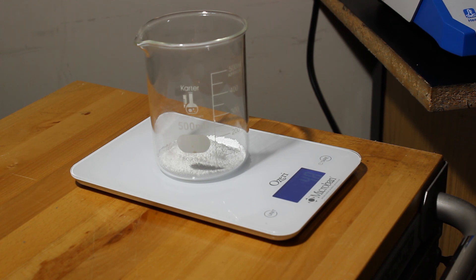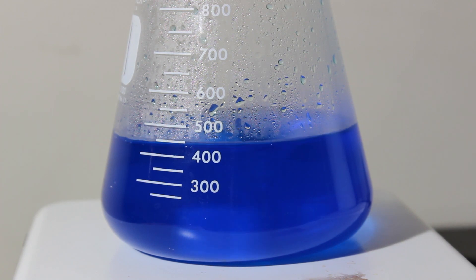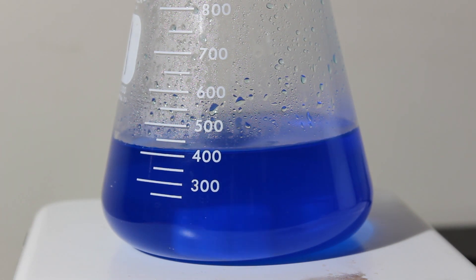Getting these into solution. I had to add a little extra water — my scale might be a little off — but there are maybe a couple of crystals left. It's time to add the sodium carbonate to the solution, even though it's taking ages to dissolve. We should see copper carbonate immediately precipitate out of solution with the evolution of CO2 gas, so I can only add this a small amount at a time or it will foam out of the container.